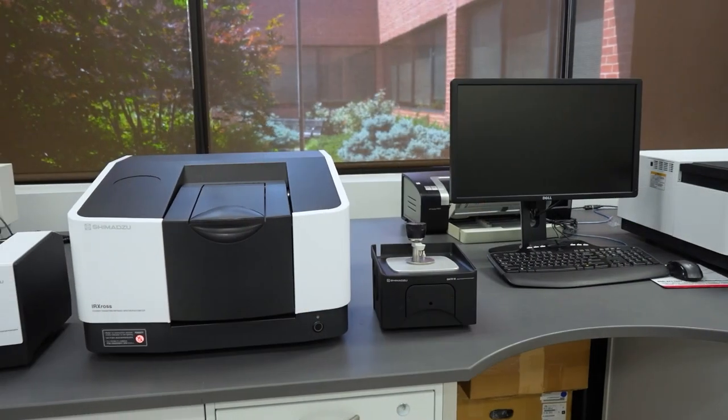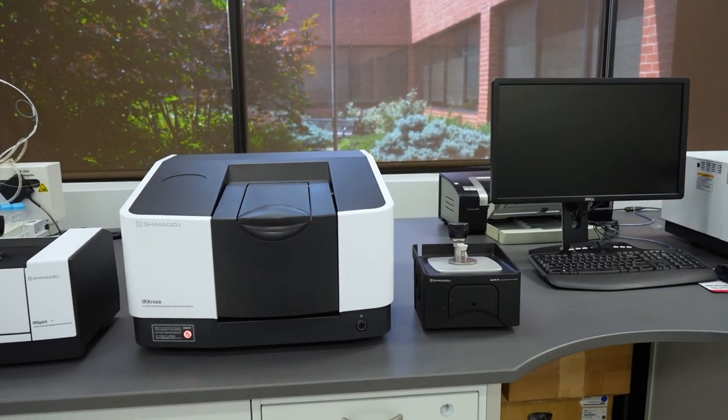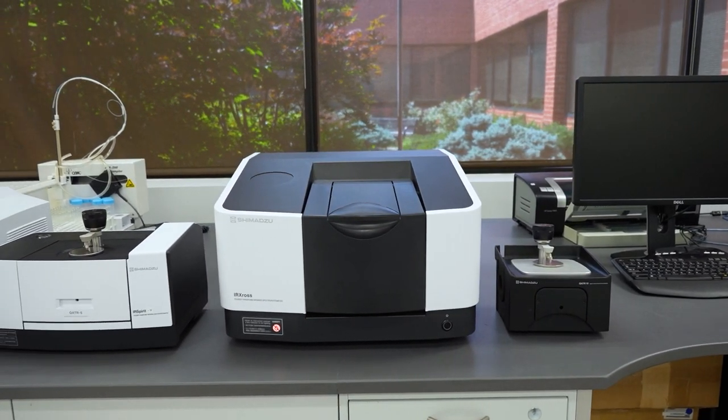Hello, I'm Dr. Rachel Lieberman, the Senior Market Manager for Clinical and Forensics at Shimadzu Scientific Instruments. I'm here today with Lauren Ostapovich, one of our molecular spectroscopy product specialists. Today we'd like to discuss our Fourier Transform Infrared Spectrophotometer products, or FTIR for short, and how they can be used in your forensic laboratory.